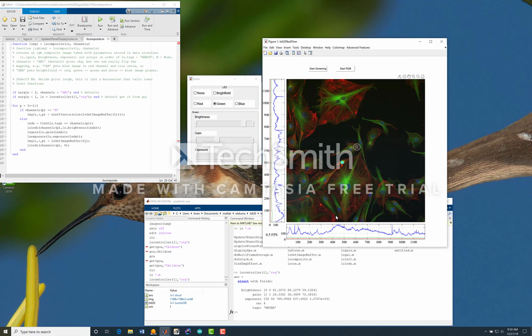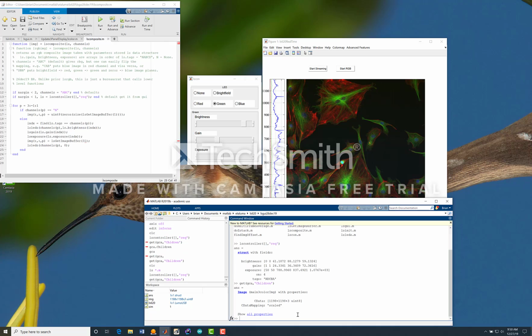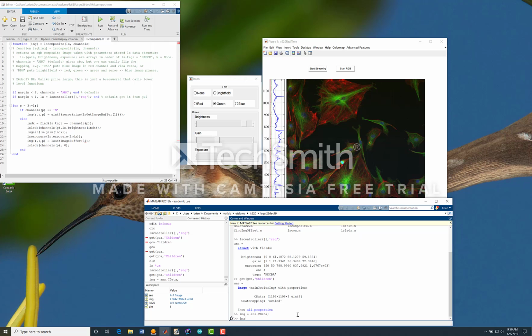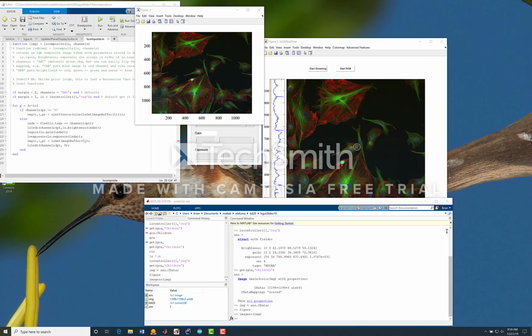Just another example of the environment. So this being a graphics window in Matlab, we can ask for the current axes. What are the children? And we see that CData is an image. So image equals answer.cdata. We'll grab a new figure window and image sc image. We've just copied the data from this figure over to here.